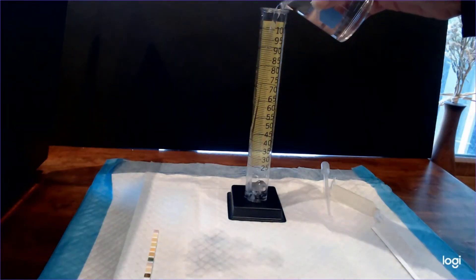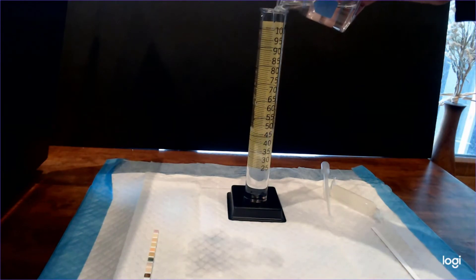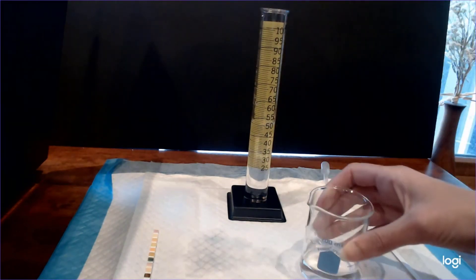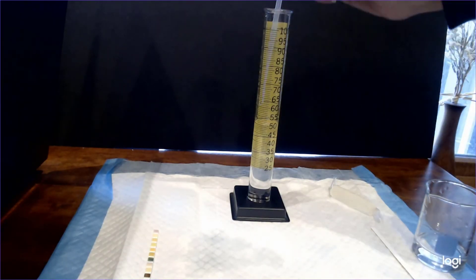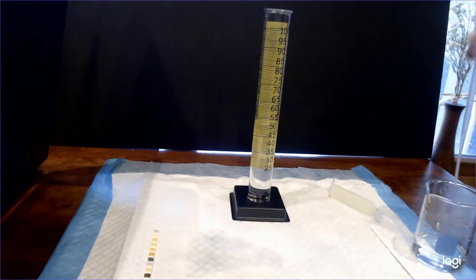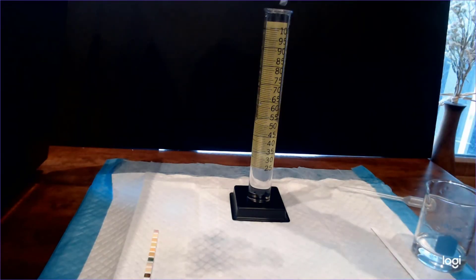Okay we're almost done but we have two more things to do and the first thing that you need to do is measure the volume of fluid in the dialysis bag. So I suspected that it probably gained some water just based on how it felt but now we're going to see if my prediction is true.